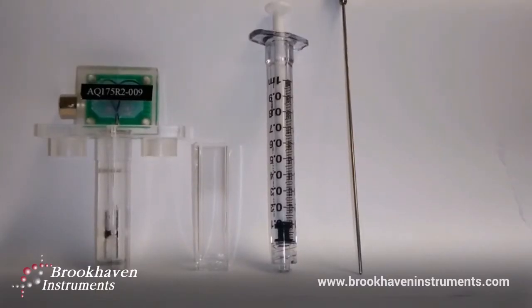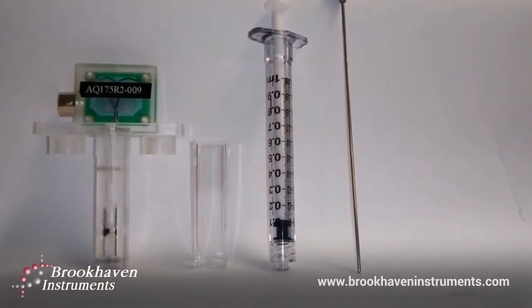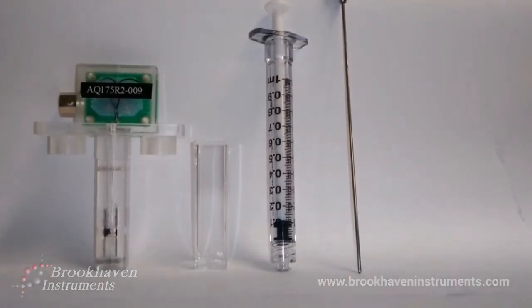I hope this video has been helpful in demonstrating how easy it is to use our small volume electrode, the SVE-175.